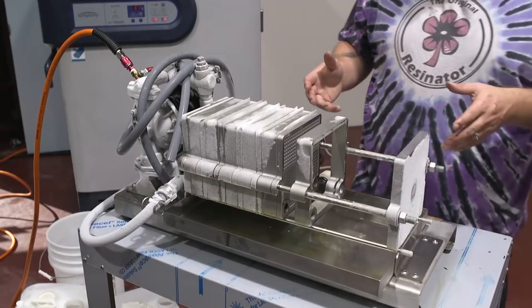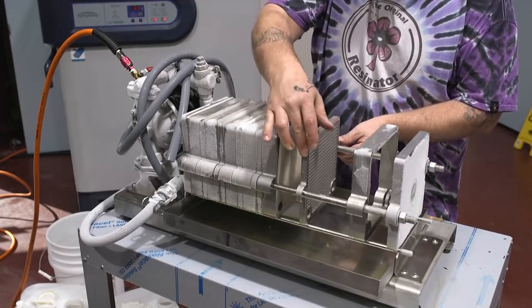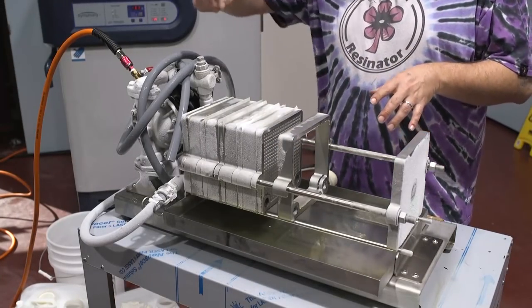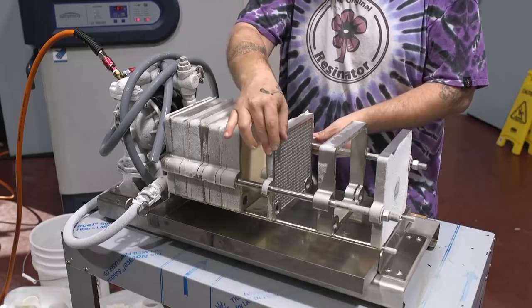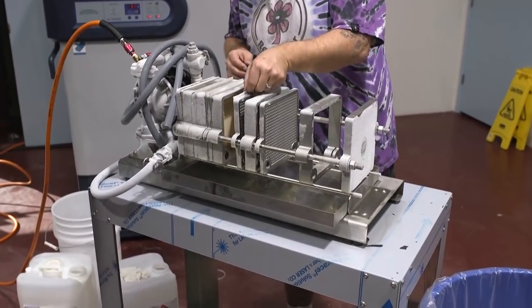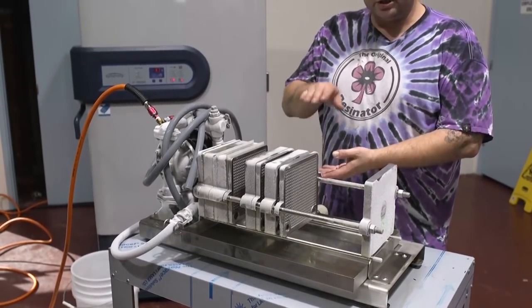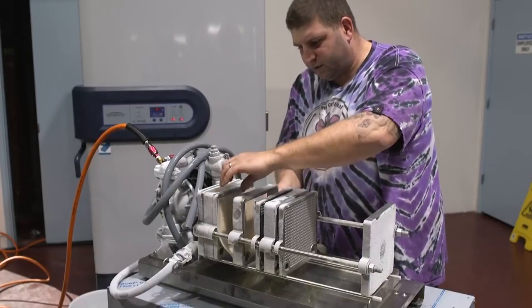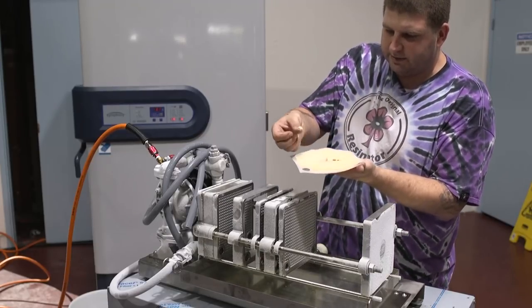We're taking the system apart to show you, after draining, exactly how much fluid is lost — which is almost nothing. Now to clean this, normally you pull all the papers out and rinse with hot alcohol on top, and the alcohol flushes everything through into the drain. We're just doing this for demonstration purposes. The loading is getting thicker and bigger toward the end — about twice the thickness. What's really interesting is you can load these plates up almost to the top and the system will continue to operate until completely loaded. Because we flushed it out with clean alcohol, there's very little oil here — very little residual. Even this cake, when it's dry, will turn pretty much white.